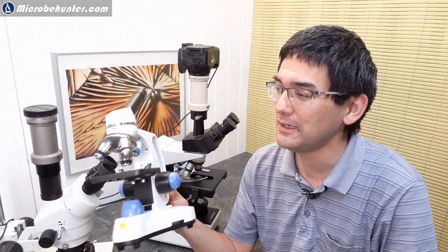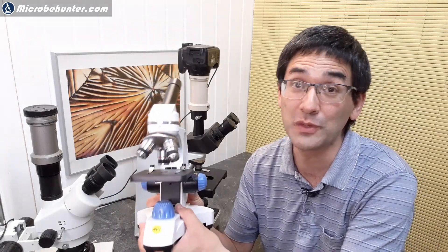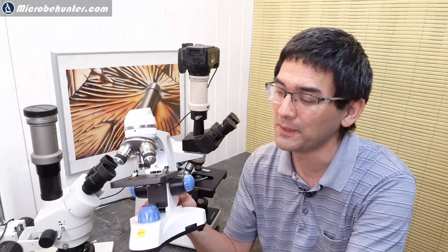Hi, hello and welcome, MicrobeHunter here. This is a Swift SW150 microscope. Just recently I made a review video of this microscope.